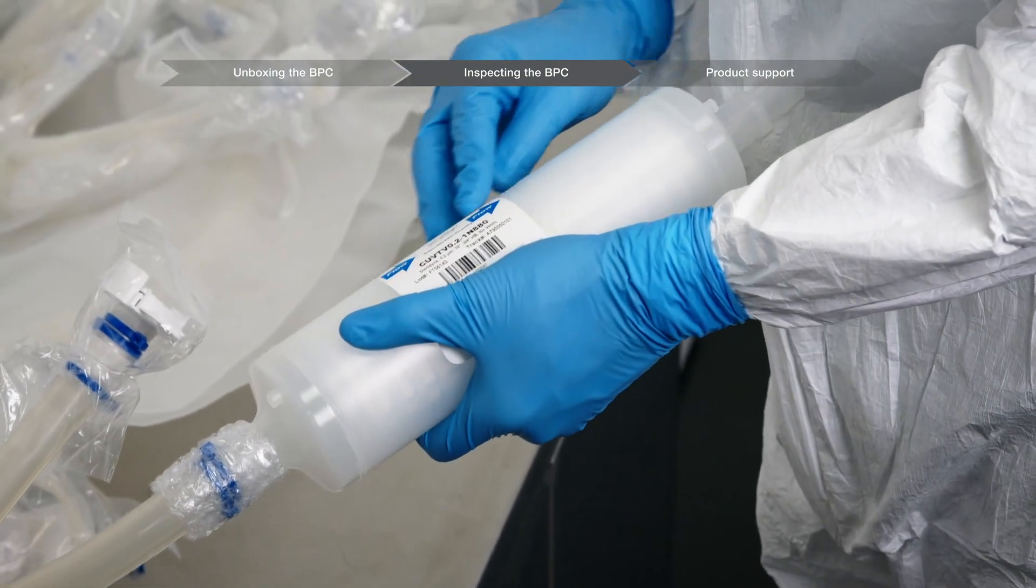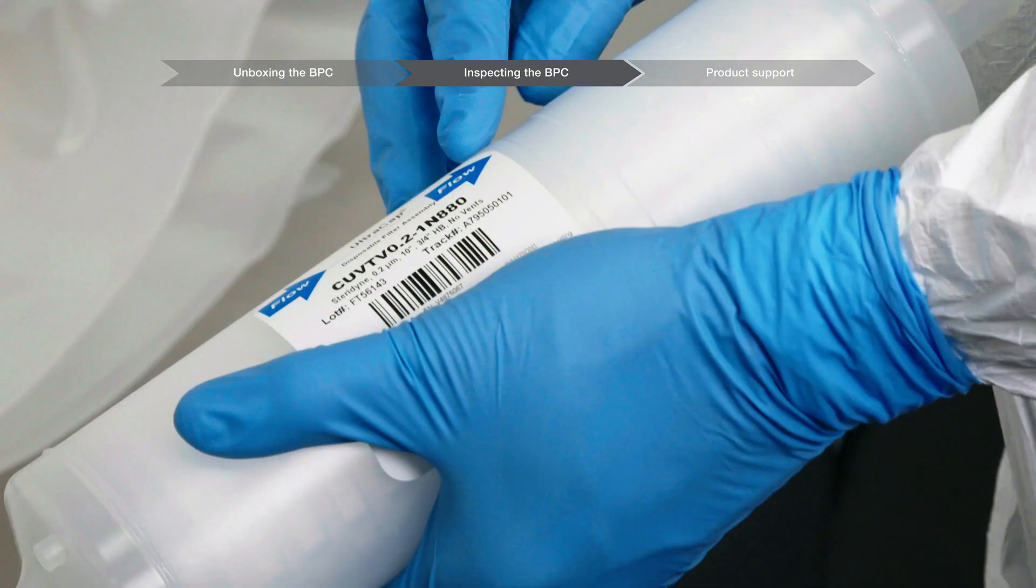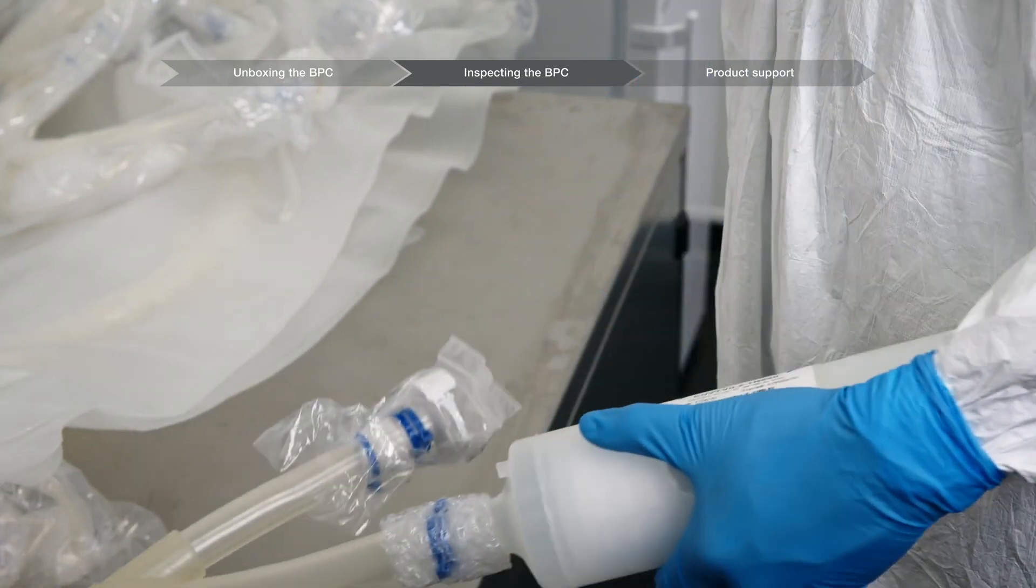Inspect the filters and verify that the flow direction matches your BPC specifications and drawings. Vents on filters are fragile, so handle with care.